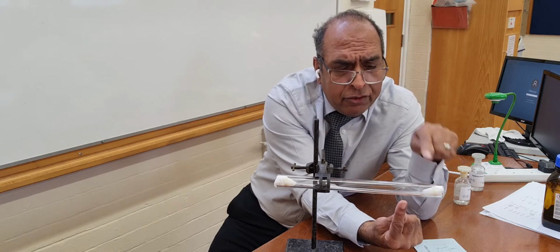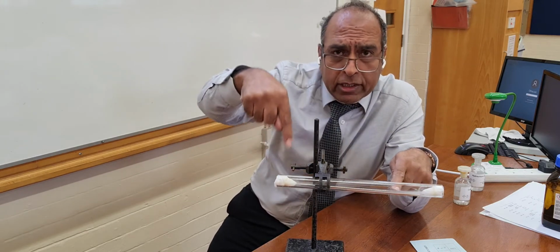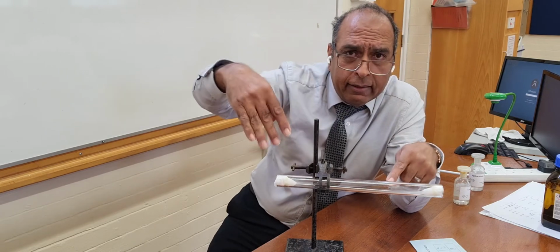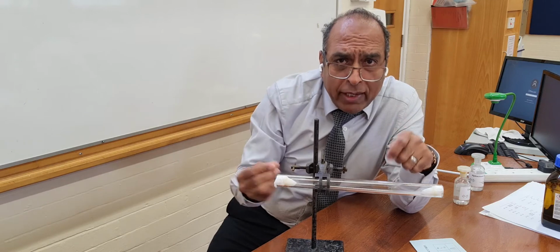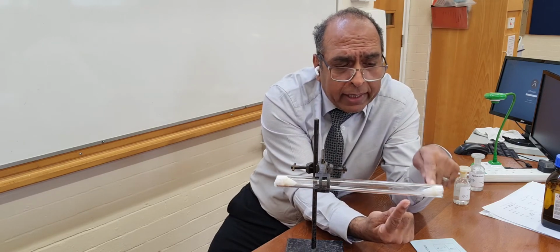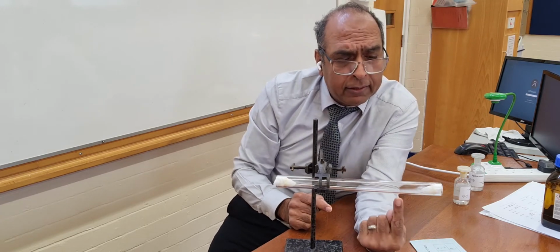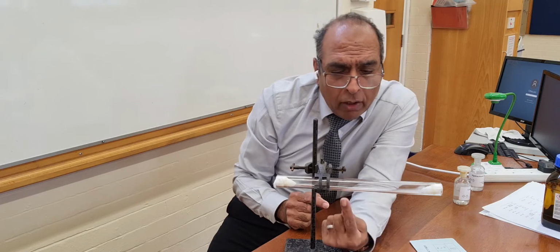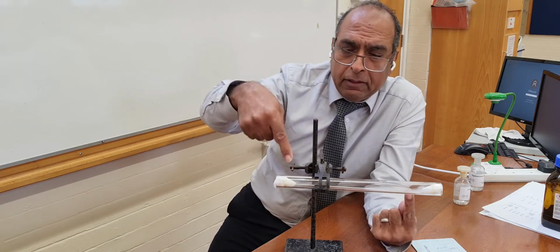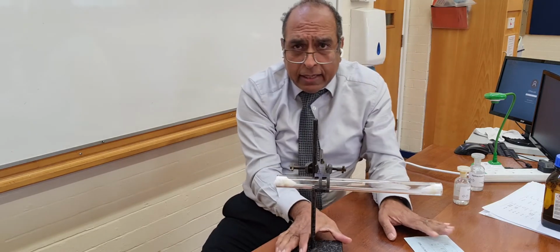So the density of this is more, the density of ammonia is less, and that's why the ammonia, being a lighter gas, will diffuse and spread out faster than the hydrogen chloride gas, which will diffuse and spread out slower. So at the same time, you get the mistiness, the white ammonium chloride appearing here, and it's not in the middle because lighter gases diffuse faster than heavier gases. So that's the second demonstration. Let's put that to one side.